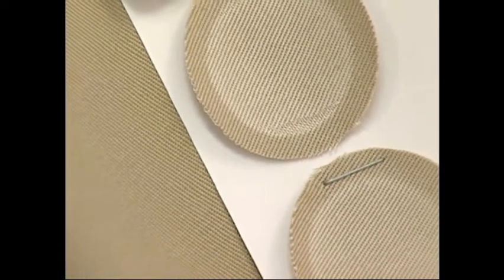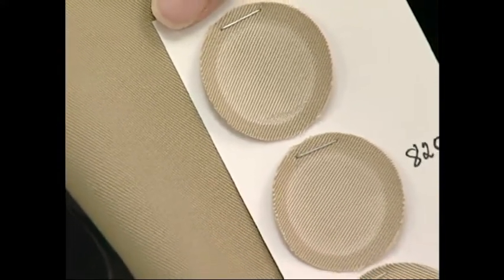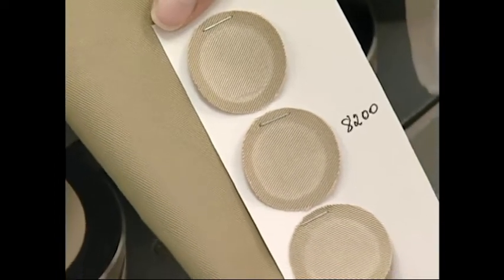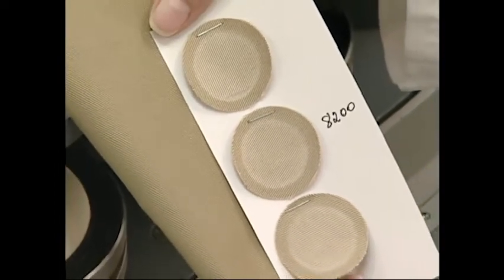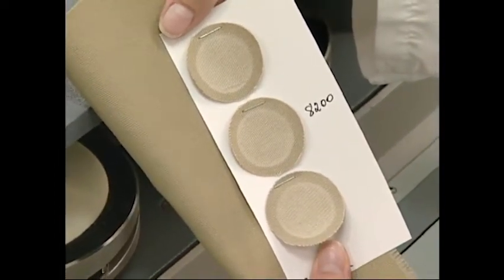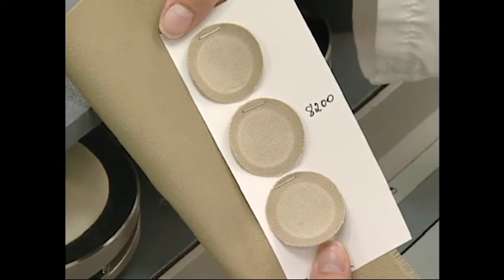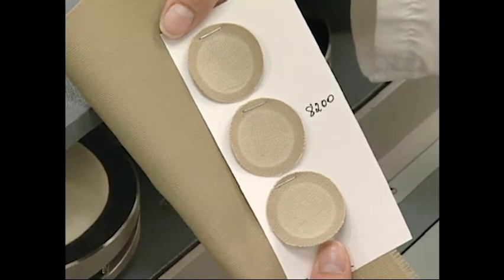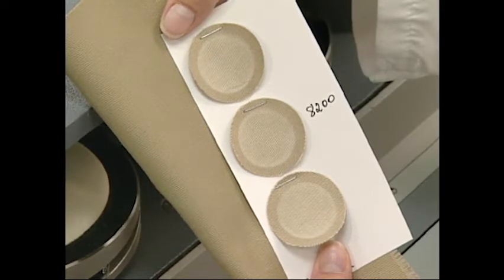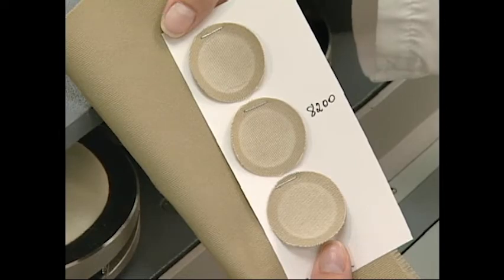Shown here are the original fabric before testing with three specimens that have been abraded to failure. Notice that there is significant loss of color as well as a rupture of the surface of the woven specimen. The number of cycles to failure is 8,200. If surface change or color loss is the mandate for a particular number of cycles, the specimens are rated upon reaching that goal. The entire test is performed under controlled conditions of pressure and abrasive action.